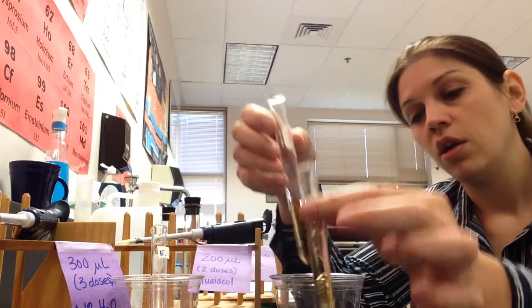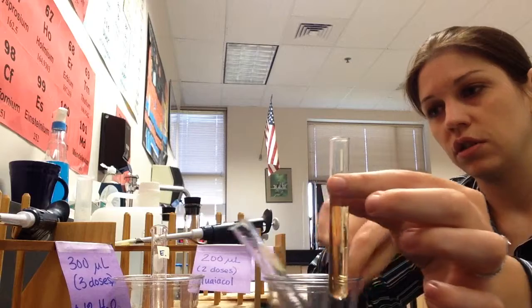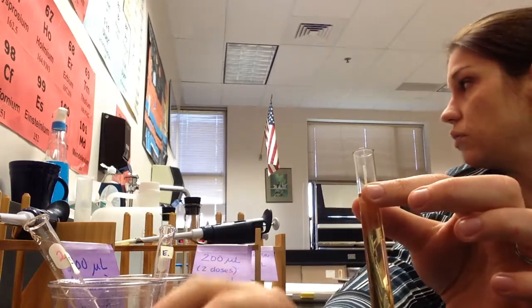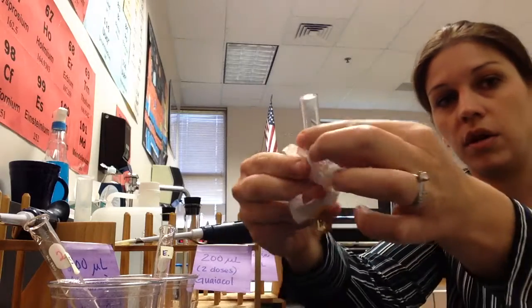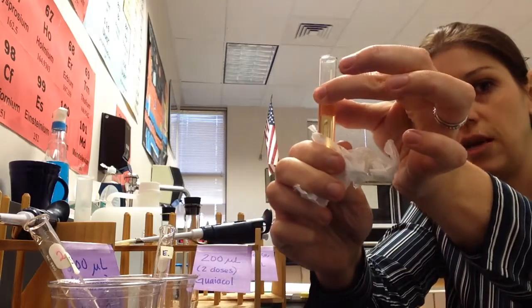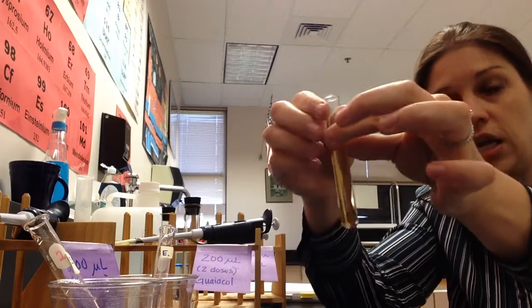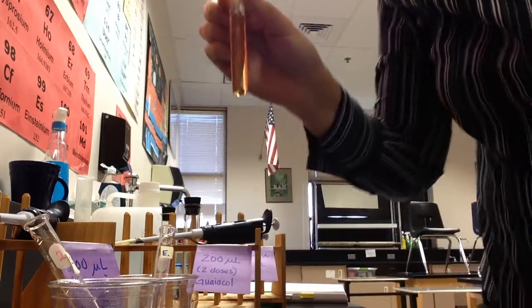It's kind of fun to actually see the color change that the spectrophotometer is giving to you in numbers. Once you've got your cuvette, chances are good that you touched it somewhere beneath that dot. If you did, you're going to use your Kim wipes. Remember, in the green box, this is not a Kleenex, it's a Kim wipe. It's special to wipe it off. And you're going to then insert this in your spectrophotometer.